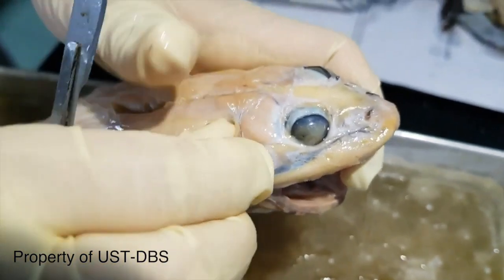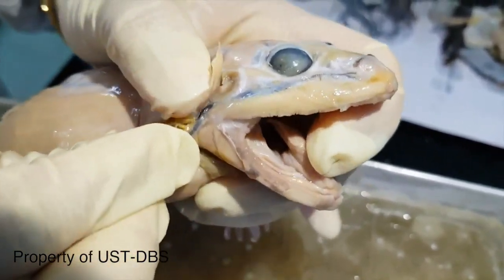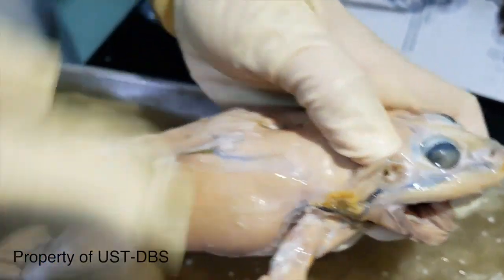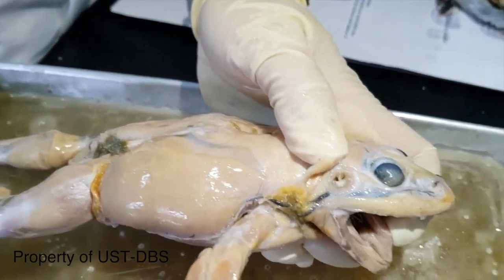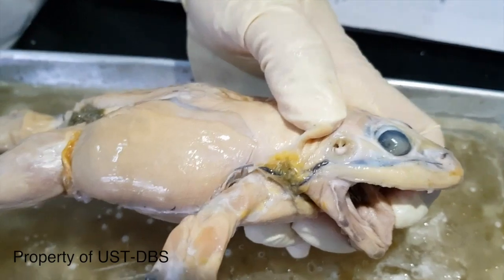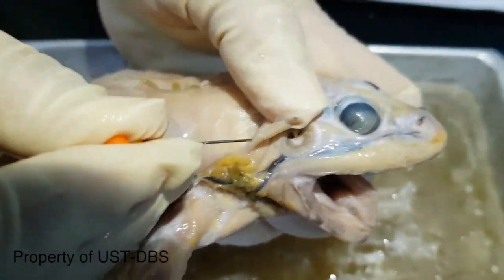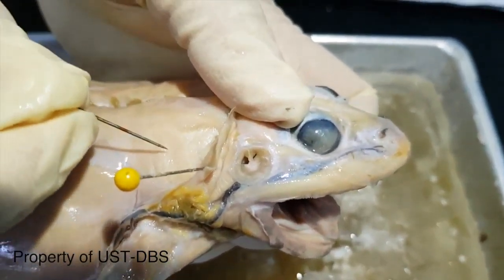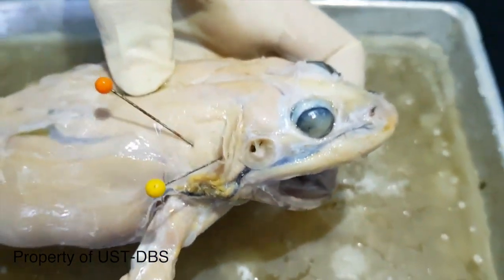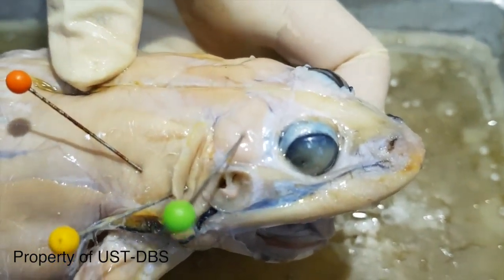So this is the depressor mandibularis, and this one at the bottom is the dorsalis scapulae. The other one here on the top is the temporalis.